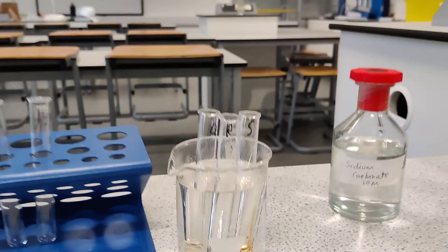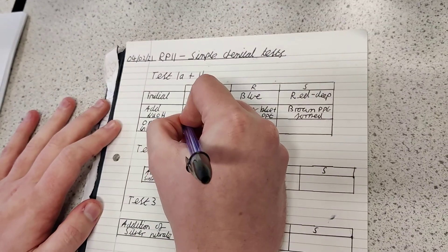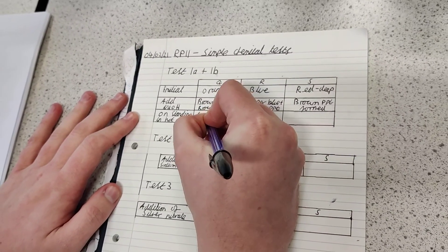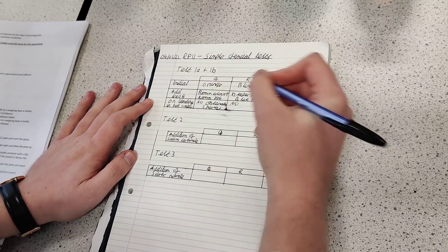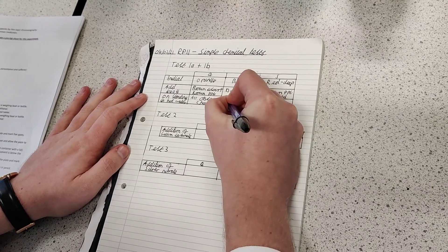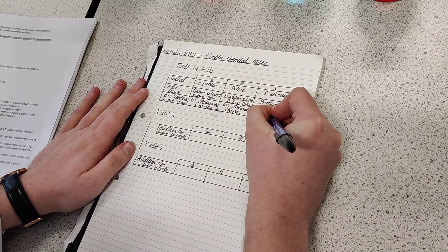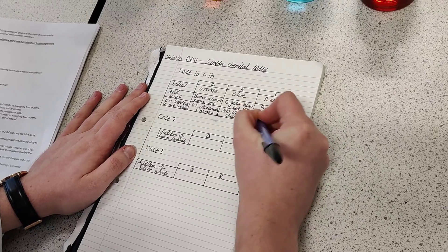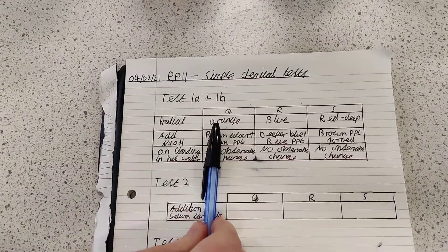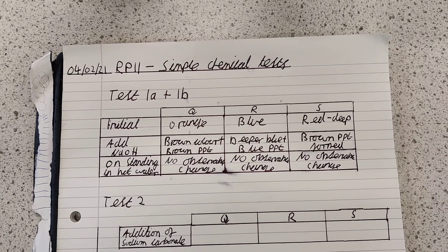So I guess we need to make a record of these. I've just got another row here, and for the hot water, we can just put no observable change for each of them. Now, I don't want to put 'no change' here, because there might have been a change but we haven't observed it. So it's very important to note down only what you can see. It's very common to get these types of questions in exam papers, where they ask you what's the positive result — in this case, there'd be no observable change.